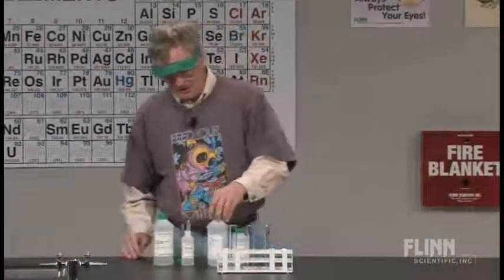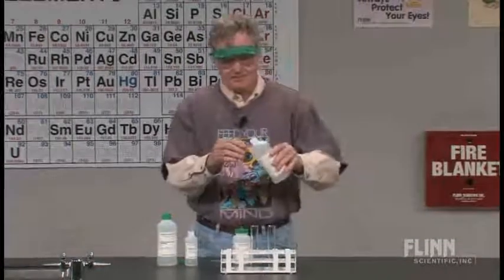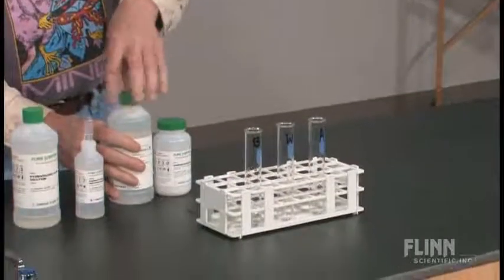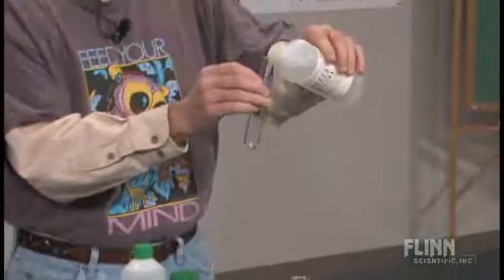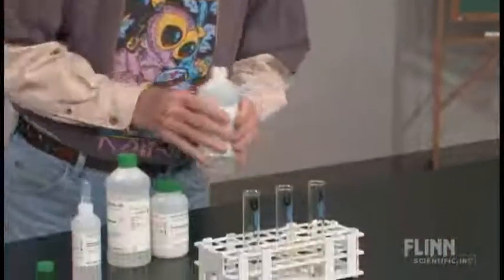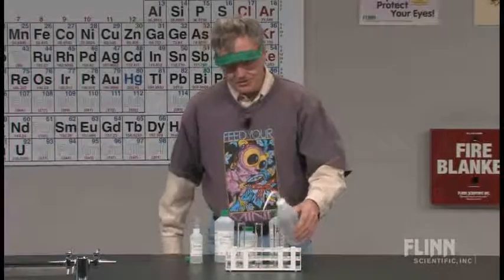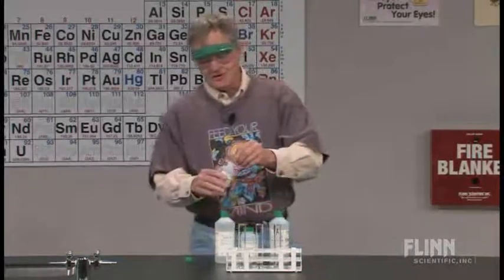I'm going to take a small amount of sodium hydroxide and put it in this test tube labeled with a B for base, and take a small amount of hydrochloric acid labeled with an A for acid. For no particular reason I'm going to put a little bit of water in the middle and label it W — I guess I could call it a control. It's not necessary, but I'll leave it there just for fun. Now I'm going to place a few drops of phenolphthalein in each of the containers.